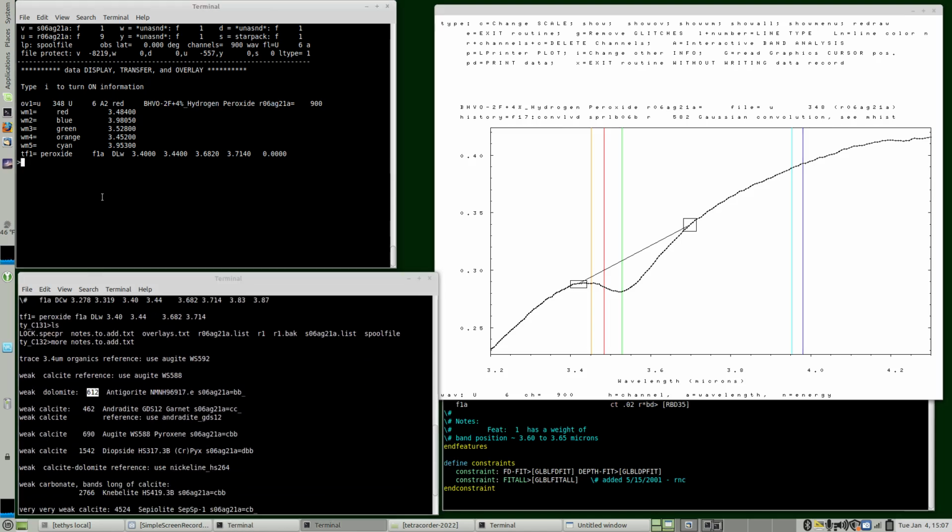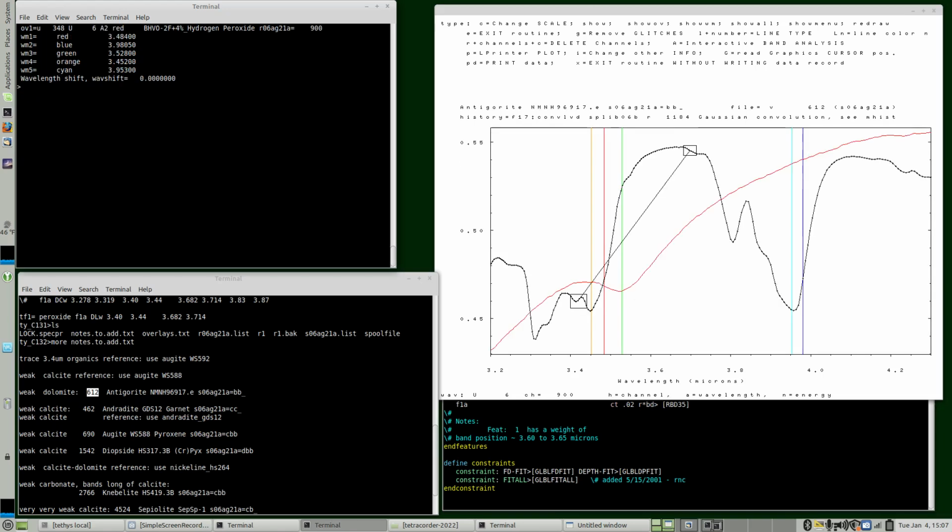Dolomite, that would be V, and we'll do an auto scale. So this is a dolomite spectrum, and here's the continuum. This is the hydrogen peroxide continuum. So we can see that dolomite will not fit the hydrogen peroxide spectrum. So the idea that this 3.5 feature in the field data was due to dolomite is wrong.